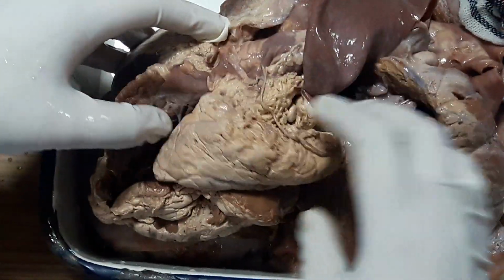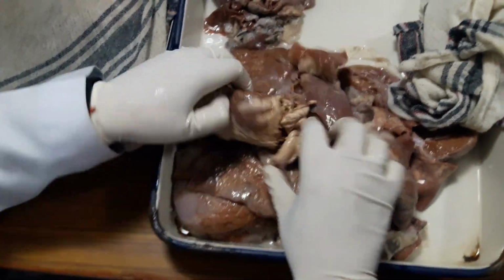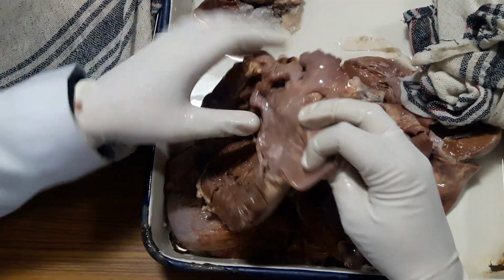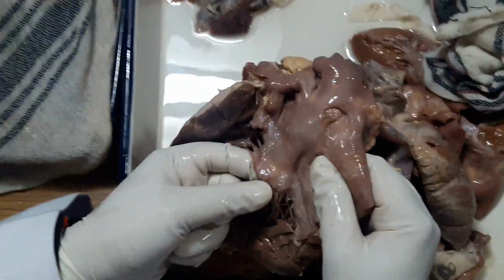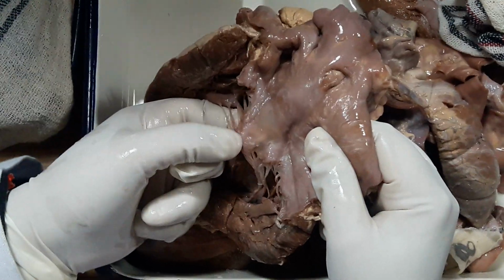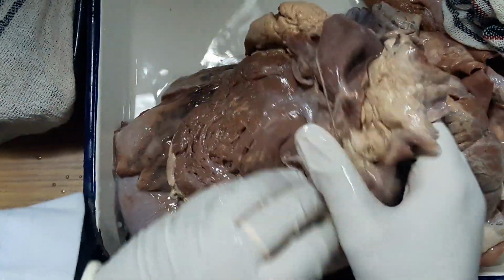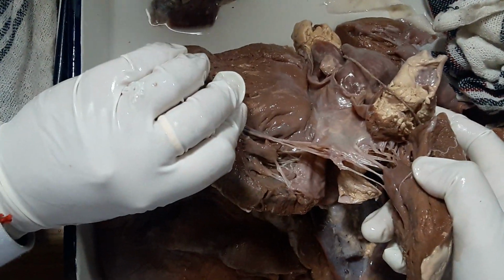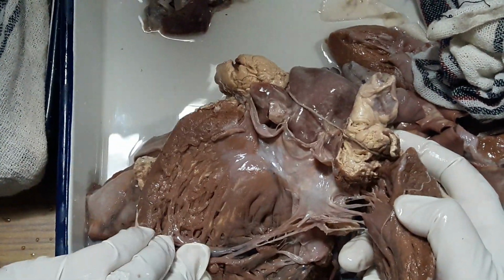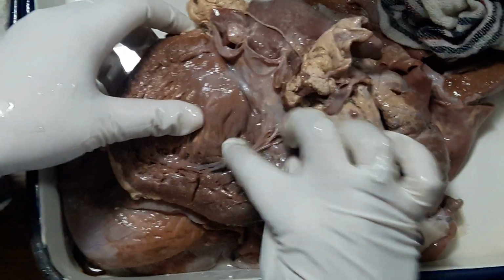This is the right side, unremarkable. This is the pulmonary artery, unremarkable. Mitral valve is not showing any obvious commissural fusion, but in the anterior leaflet there is mild thickening that is due to hemodynamic effect, because it is close to the aortic valve. Anterior valve leaflet sometimes gets hemodynamic changes. You see the chordae tendineae, they are quite long and slender. They are actually normal.